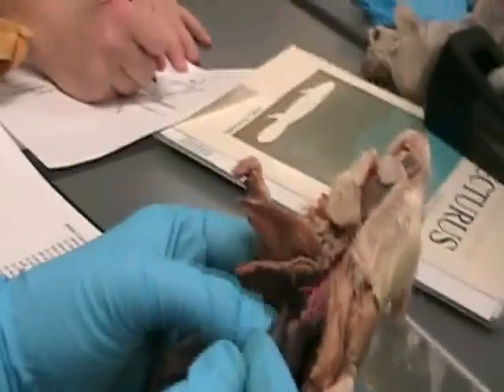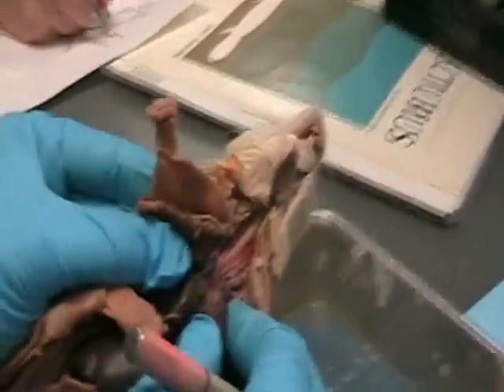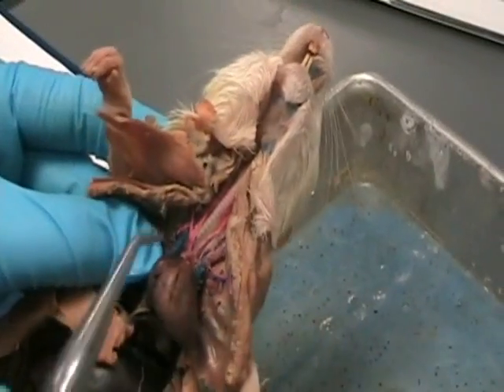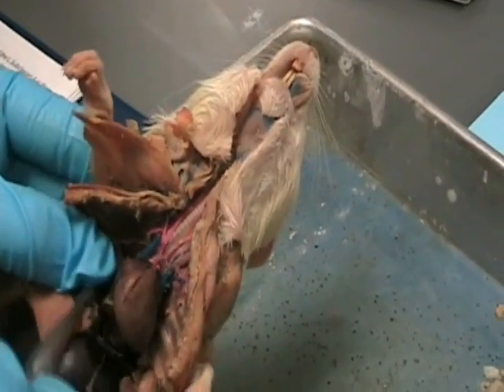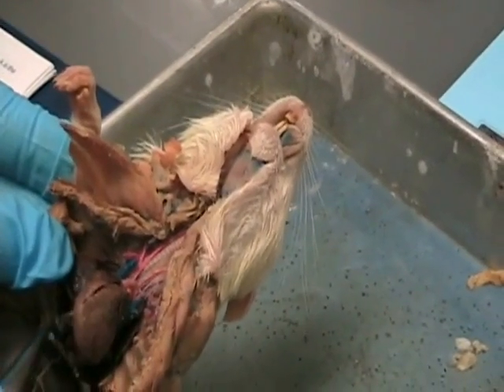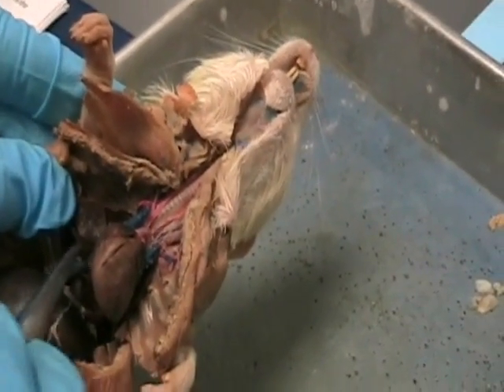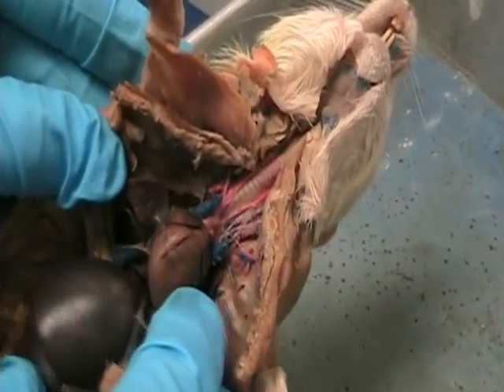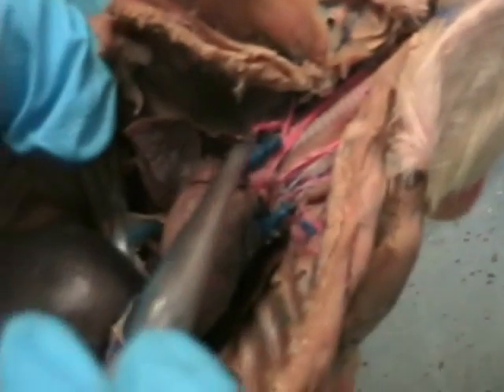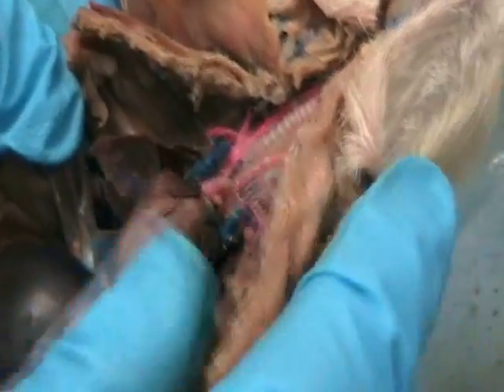Okay, so here are the two atria. This is the right atrium, or the right auricle containing the right atrium. So this major blue blood vessel that's dumping in here, and the one that's coming from the bottom and dumping in here, also in the right atrium, these are the caudal vena cava, or you can call them posterior vena cava. And this is the cranial one that's all broken, but okay?